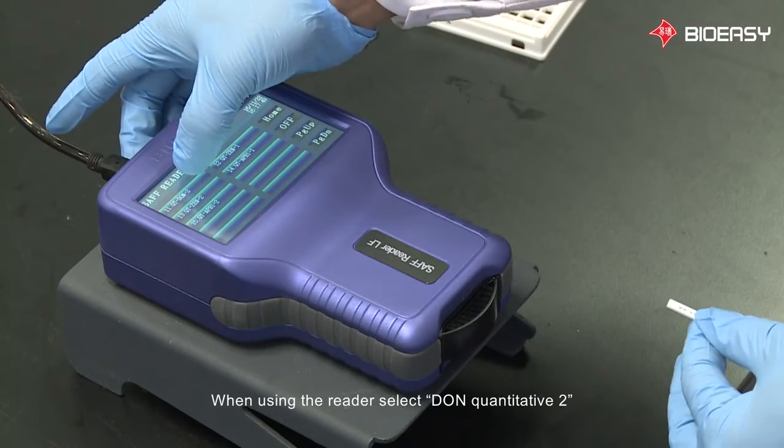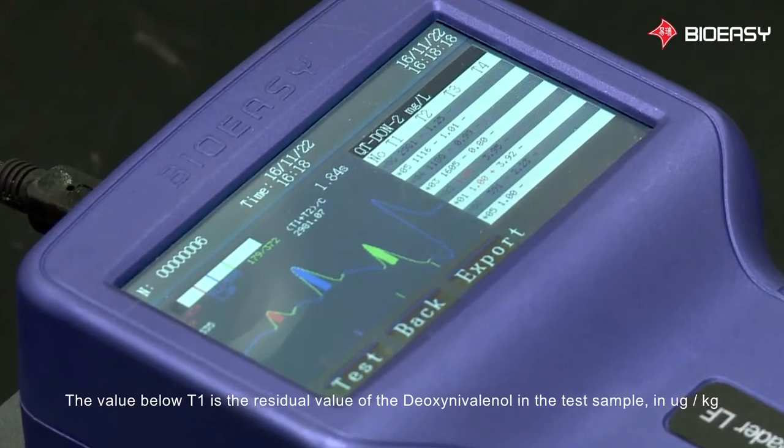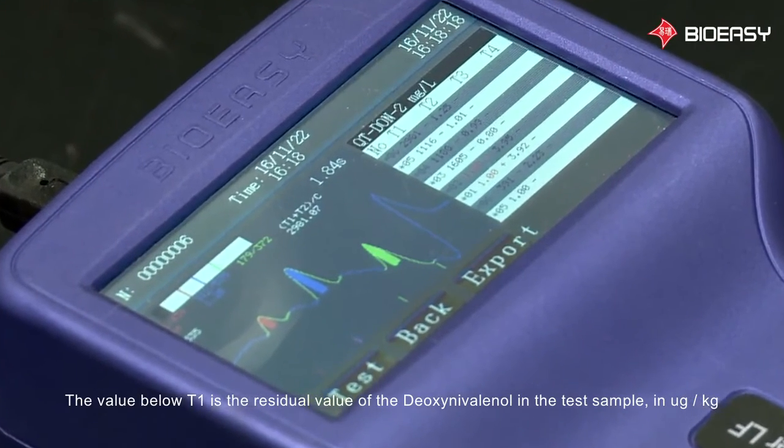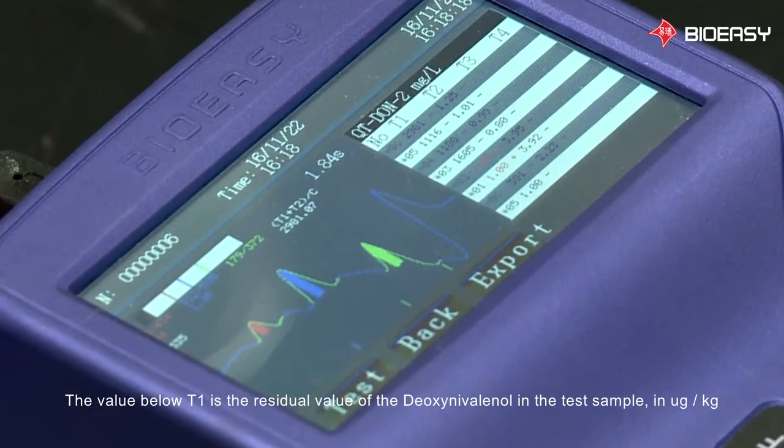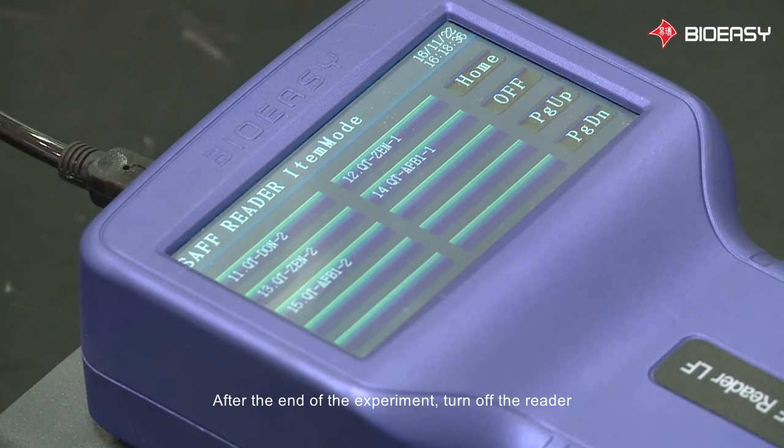When using the reader, select DON Quantitative 2. The value below T1 is the residual value of the deoxynivalenol in the test sample in microgram per kilogram. At the end of the experiment, turn off the reader.